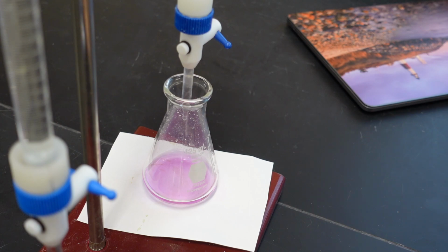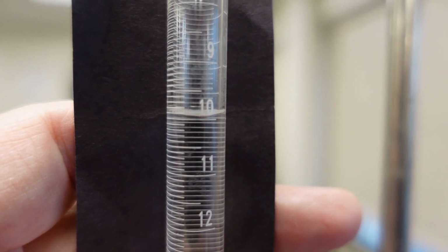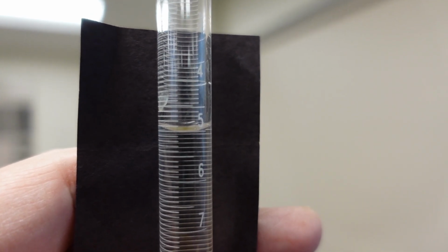So now that we have our end point, let's get our final volume of acid and final volume of base, which remember will become your initial volume of acid and base for trial 2. Make sure to read this device very carefully. It is marked to the 10th of a milliliter, and you read it upside down of the way you would normally read a graduated cylinder. Volume of the acid. Final volume of the base.